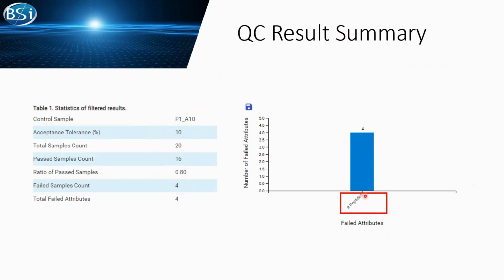And what are they failing on? They seem to all have a low peptide number. So now I have an idea of the percentage of my passed samples, the percentage of my failed samples, and what attribute they failed on. They seem to all focus on the peptide numbers. But how good is the pass? We say we passed, but do they only barely meet the threshold? So we may want to take a look.